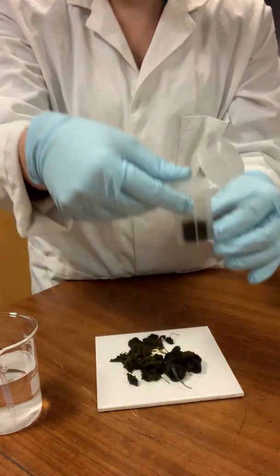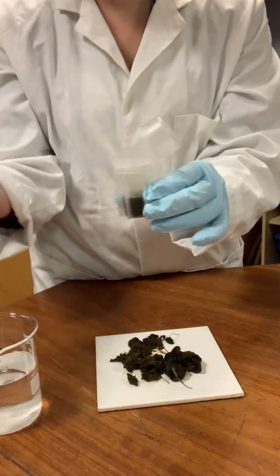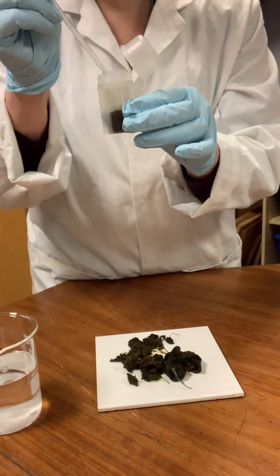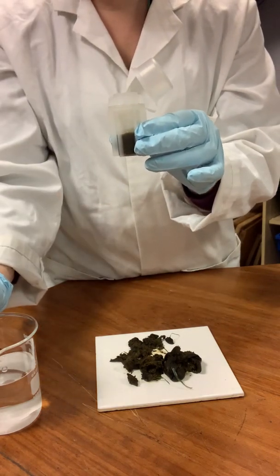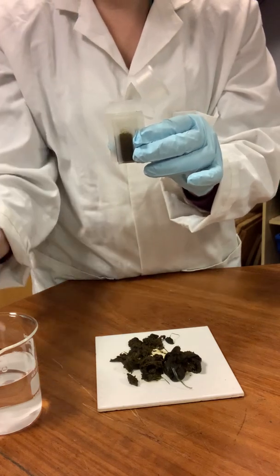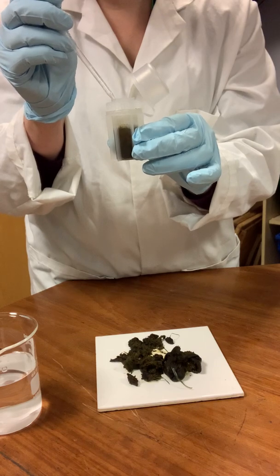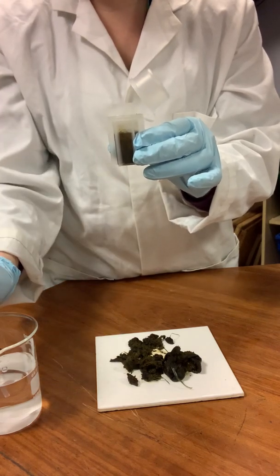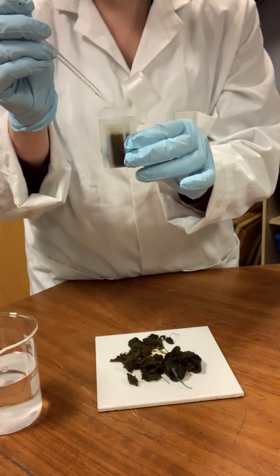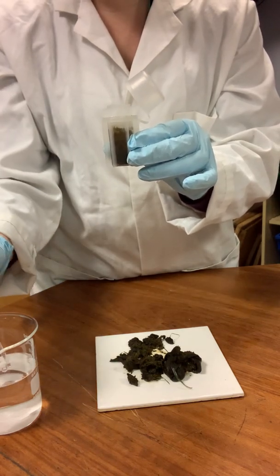Pop it all the way down, and then what we want to do is take some more of our solution, and we're basically going to top it up. So I'd encourage you to do it nice and slowly, so we don't contaminate ourselves or the workbench. You obviously can put the sample pot on the workbench, it's not necessary to hold it up in the air as I am. That's just so that you can see what's happening.